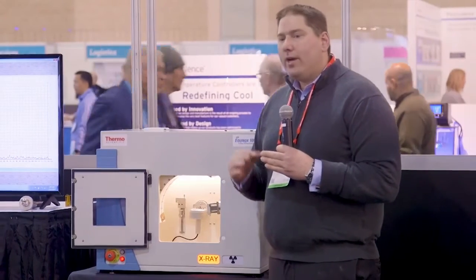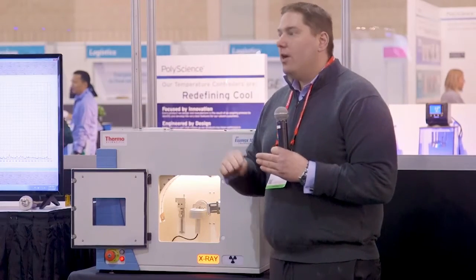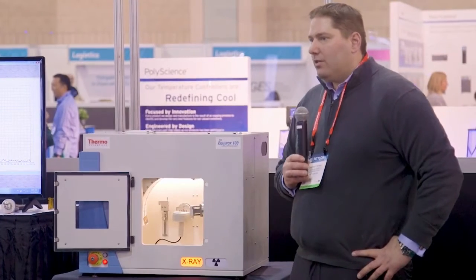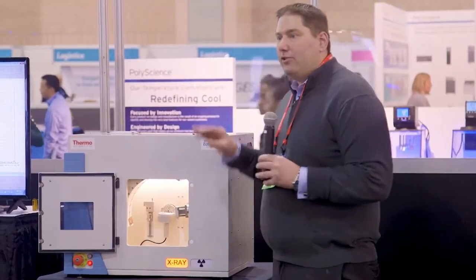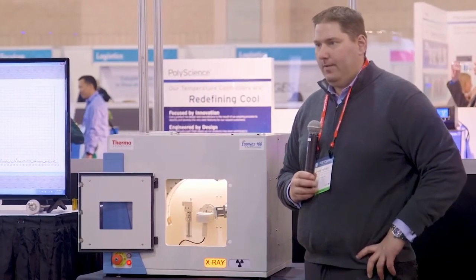So if you are creating a new material and you're worried that there's some intermediate phase that may be really influencing or maybe detrimental, you can actually watch and see if that phase pops up. So it's really nice for QA, QC and research on a benchtop system. There are not very many benchtops that allow you to add these types of accessories. So it's a very nice entry level, but yet has research grade accessories that you can put onto it.